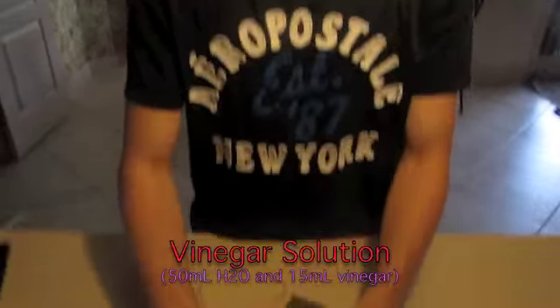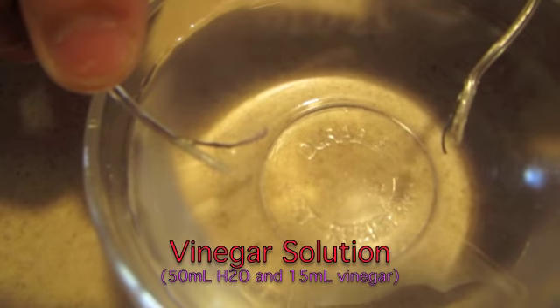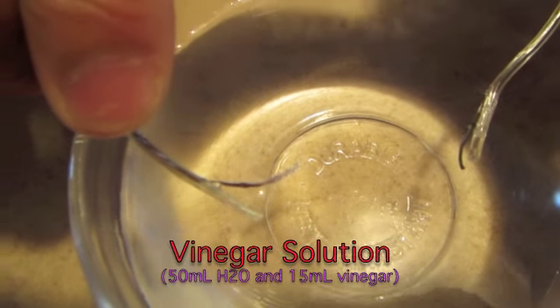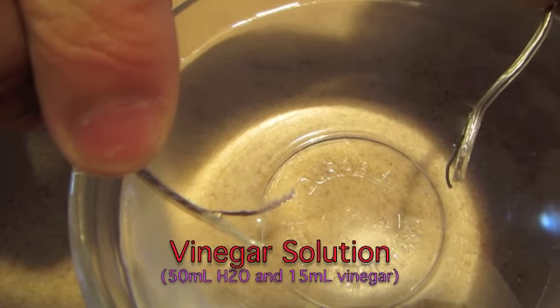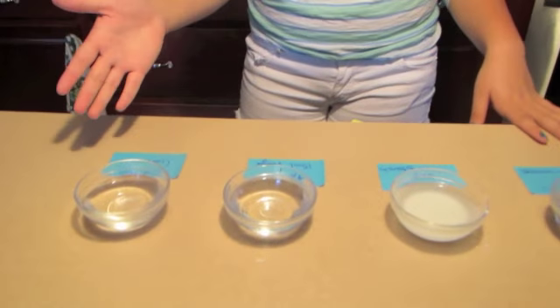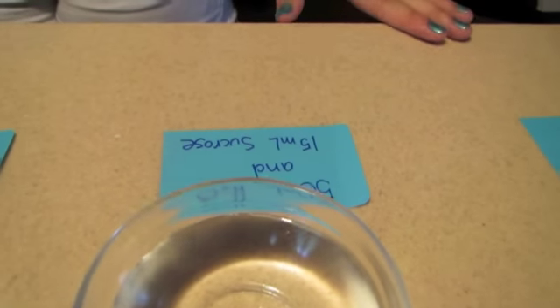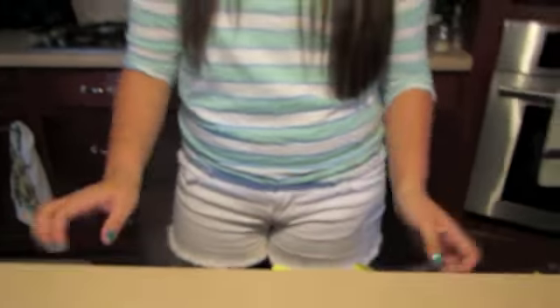Alright, this is the vinegar solution, and it's going to produce the same amount of bubbles as the last one. And it's covalent. The starch, sucrose, and vinegar produce the same amount of bubbles as the H2O, which is the control. Therefore, the electricity did not affect it as much, making them covalent.